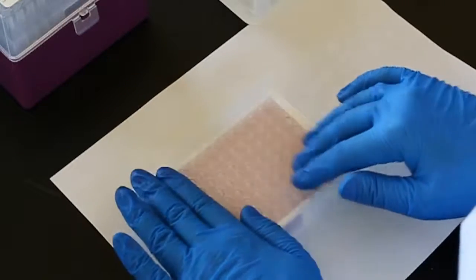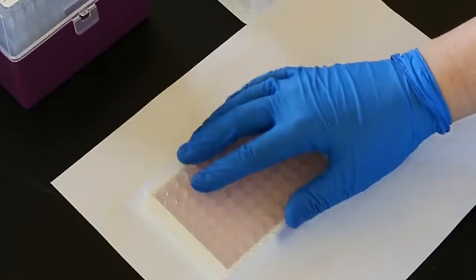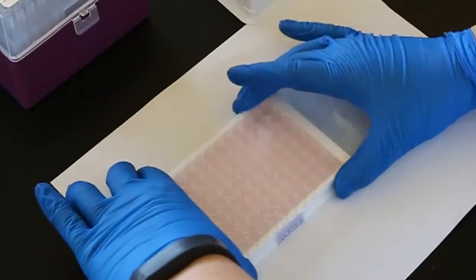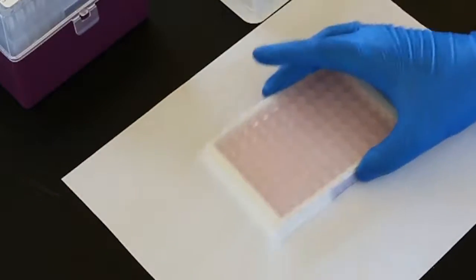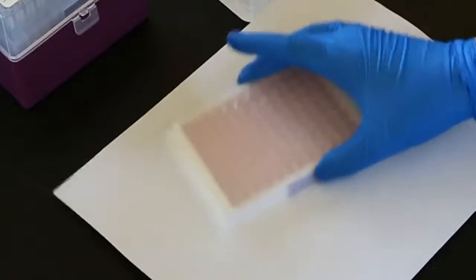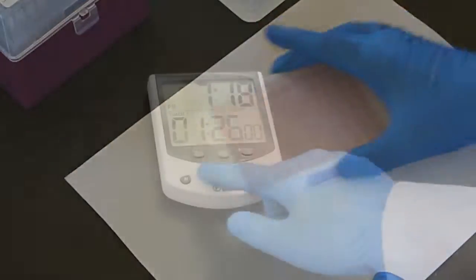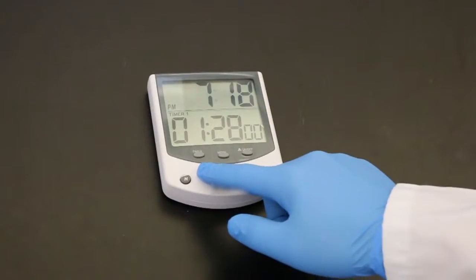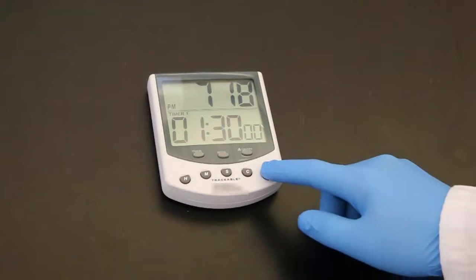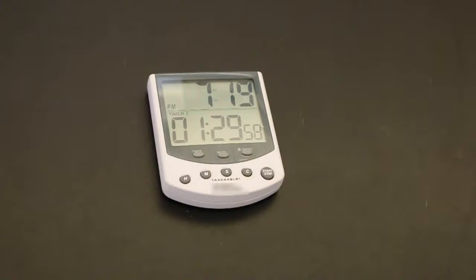The wells are then covered with parafilm or tape and the contents are mixed by moving the plate in a circular motion on the benchtop for 30 seconds. The plate is incubated at room temperature for 90 minutes.